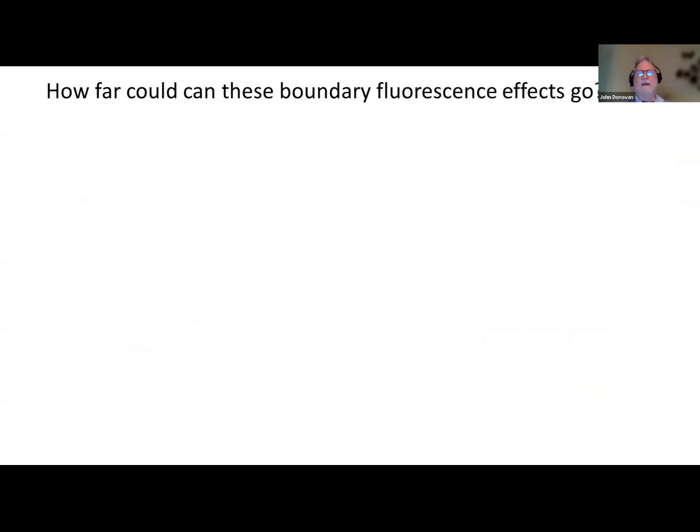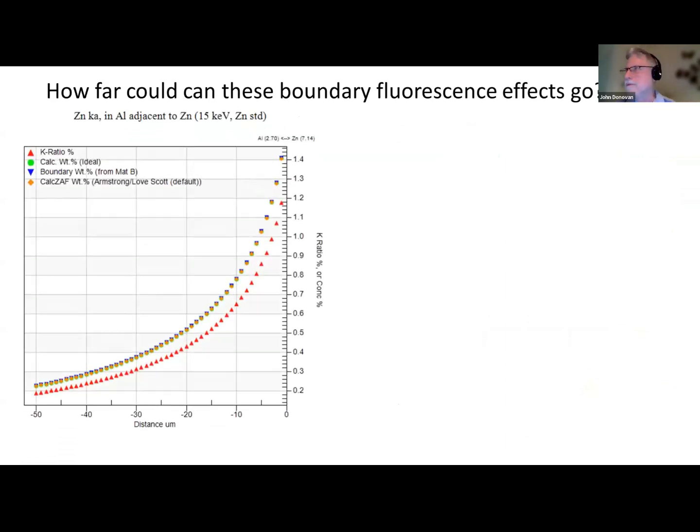So how far could these boundary fluorescence effects go? Some time ago I was contacted by Oak Ridge, and they were getting a weird thing where they were measuring zinc adjacent to some aluminum alloys at a considerable distance from the phase boundary, and they wondered what I thought. So I modeled it. Here we have pure aluminum adjacent to pure zinc, and we're getting about 1.4 weight percent at 1 micron from the boundary. And this is not electron leakage. This is actually X-ray fluorescence. The X-rays go much further than the electrons, and in this model we don't even consider the electron leakage.